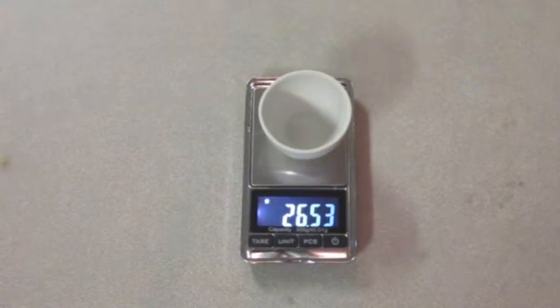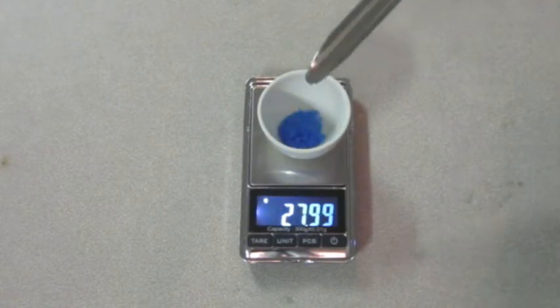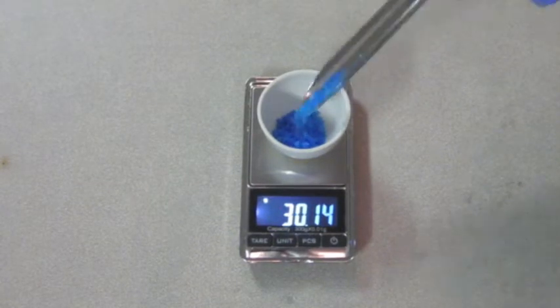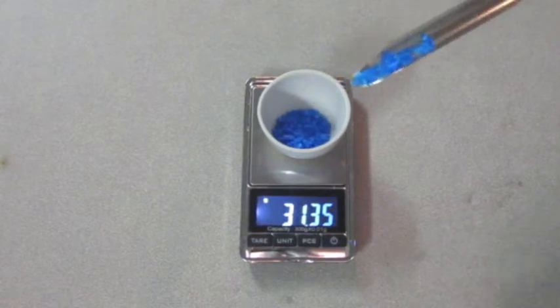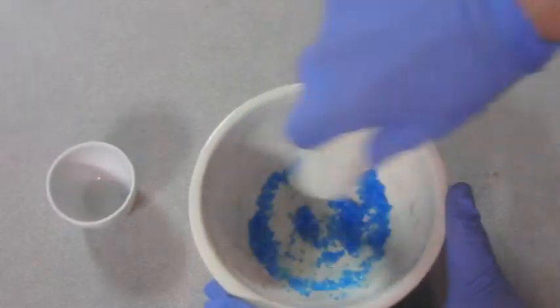First, place a crucible on your balance and record its mass. Then measure out some of the salt in the crucible and record that mass. The mass of your salt is the second value minus the first one. I have measured out exactly 4.99 grams. I had to grind mine down in a mortar and pestle because the crystals are so large.